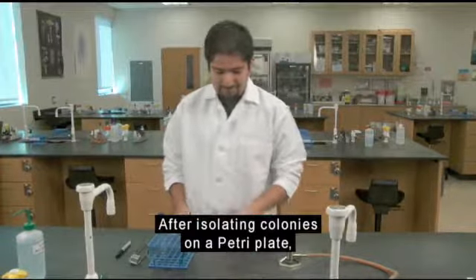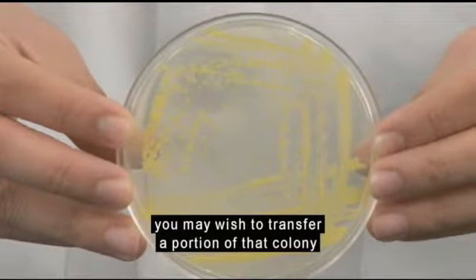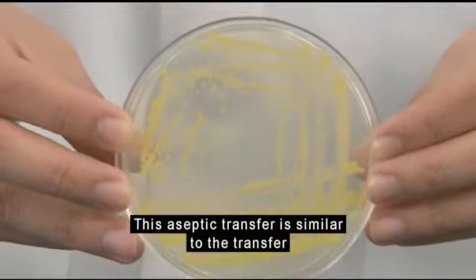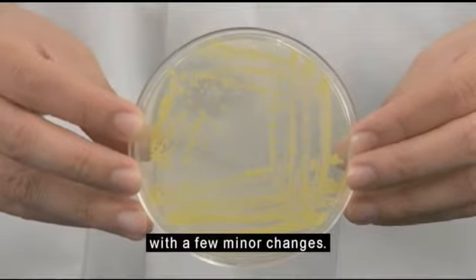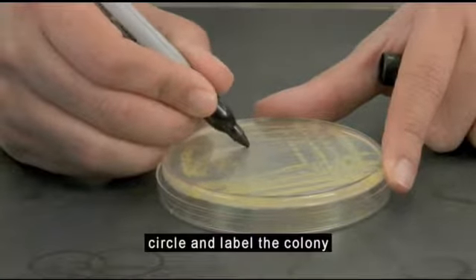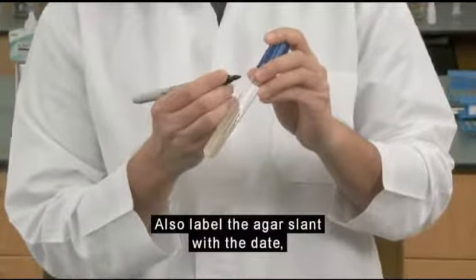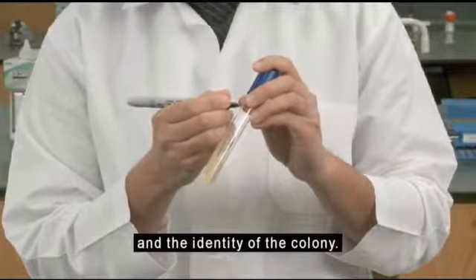After isolating colonies on a Petri plate, you may wish to transfer a portion of that colony to a slant for long-term storage. This aseptic transfer is similar to the transfer from an agar slant, with a few minor changes. On the bottom of the plate, circle and label the colony that will be the source of your inoculum. Also label the agar slant with the date, your initials, and the identity of the colony.